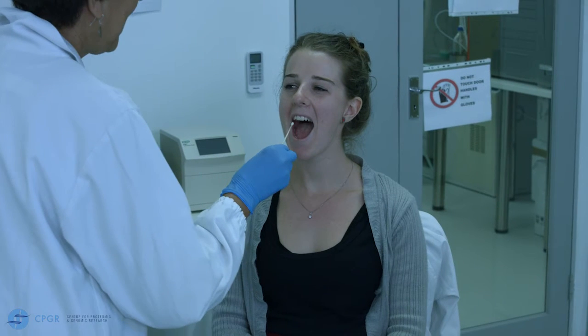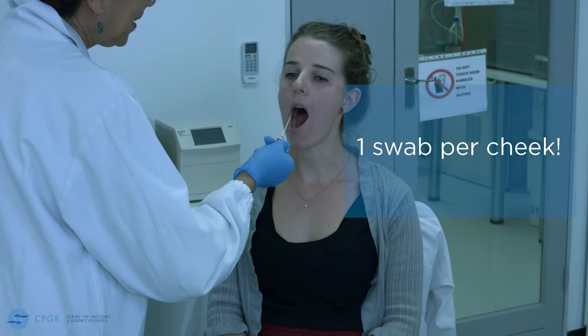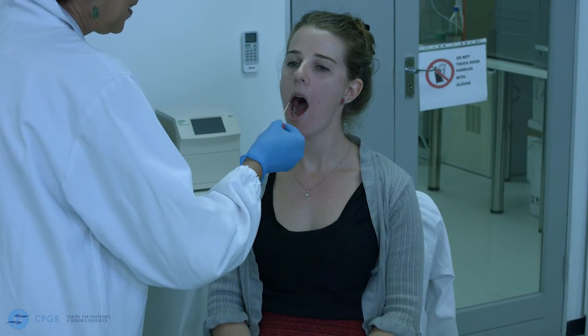Place lateral pressure on the swab in order to collect cells from the buccal wall and vigorously rub the swab on the inside of the cheek. Do not let the swab touch the teeth.